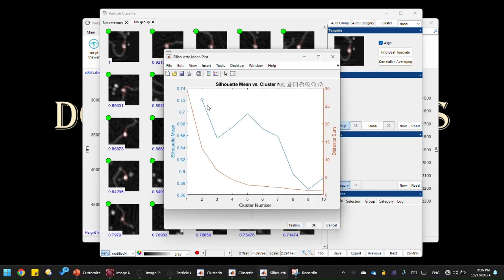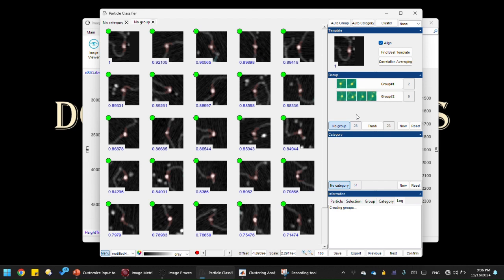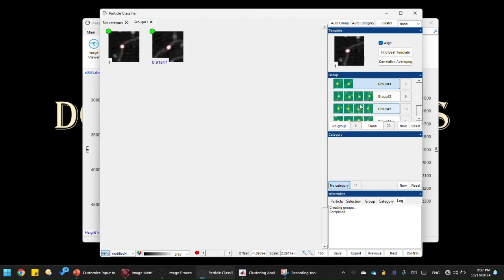And it will generate this silhouette plot. I'm going to avoid the technical details, which you can find in my thesis. Basically, I want to use a local maximum for the silhouette mean, which is this blue line. Here I find the local maxima, which indicates 5 is a good number to use for our cluster number. So I'm going to input 5 here as the number of clusters for our clustering using k-means. Okay, I'm going to click OK, and it's generating 5 groups or 5 clusters here. So let's see how well it does.